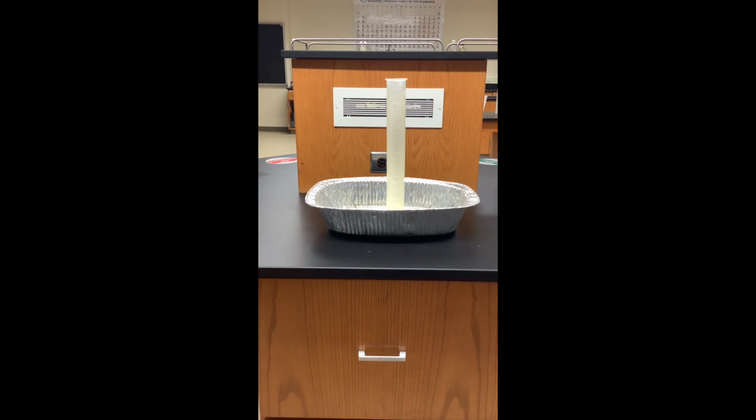In this experiment, we're going to be looking at the effect a catalyst has on the rate of a chemical reaction. And this was actually done recently, and if you have Disney Plus, the Muppets Now show with Beaker and Honeydew, they do this reaction, and so they have some graphics showing you what's going on. So what I'm going to do is make a chemical reaction with the compound hydrogen peroxide.